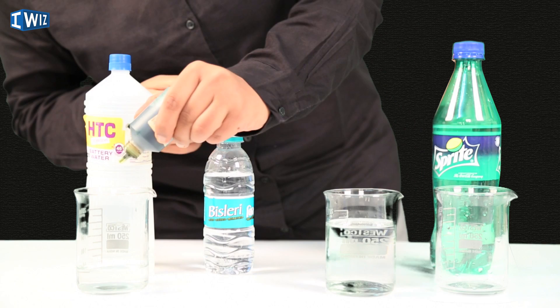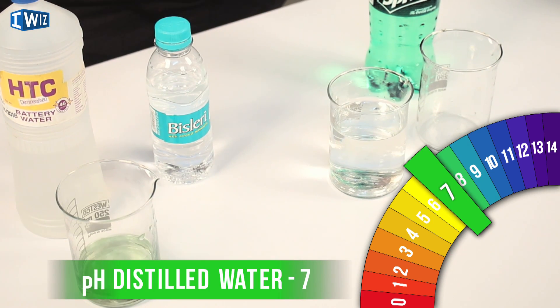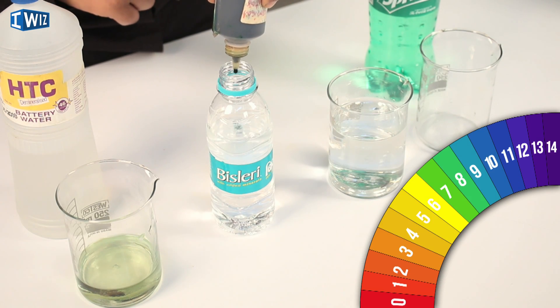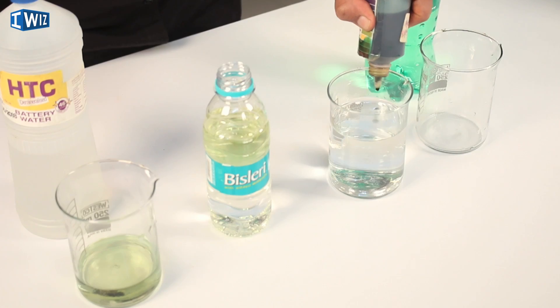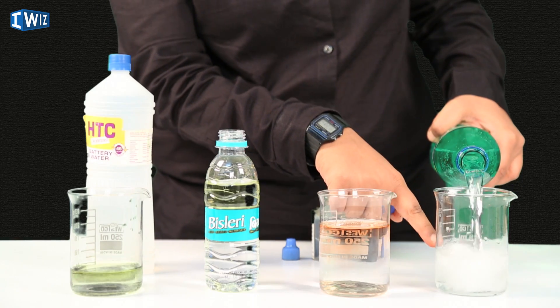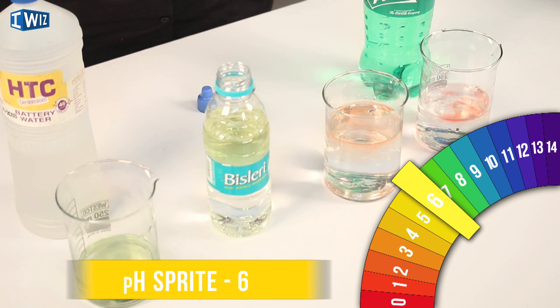Let's test the pH of all of them. Distilled water turns the indicator green — green is pH 7 — so distilled water is neutral. Mineral water also turns out to be neutral. Water from the swimming pool turns slightly orangish, meaning it is slightly acidic. Then we have carbonated water — we used Sprite because it's clear. You can see all the fizz, which is the carbon dioxide escaping, and this water is also slightly acidic.